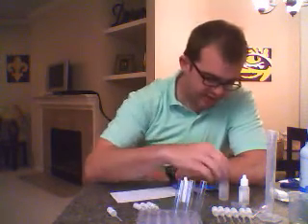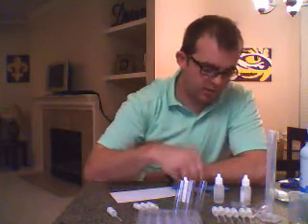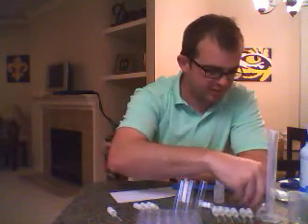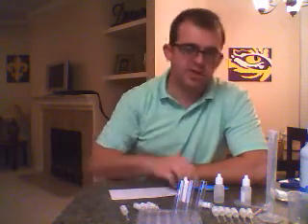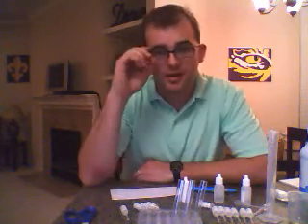We have silver nitrate, hydrochloric acid, and our unknown. And we've got our cylinder, beaker, and a couple of extra pipettes to use. Things to take notes, scissors, and we are set and ready to go.